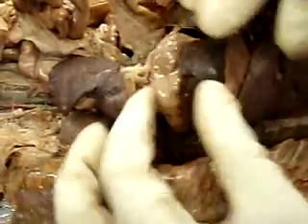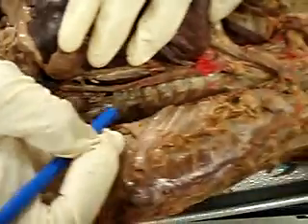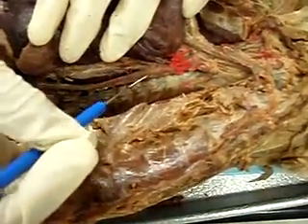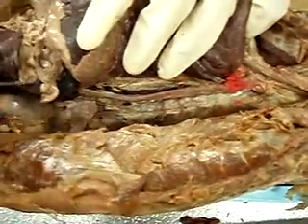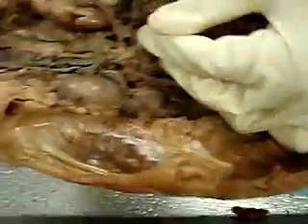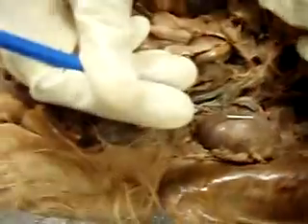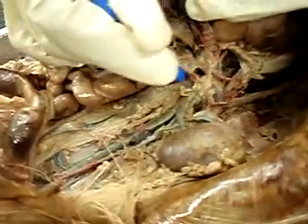Okay, going back inside here, first of all, here's the diaphragm. That's the dividing line. This meaty portion right here, more brownish, not as dark. Everything above this diaphragm would be the thoracic aorta. Everything below the diaphragm is the abdominal aorta, and it goes all the way down into the abdomen. Going on, you see here, this is the kidney.